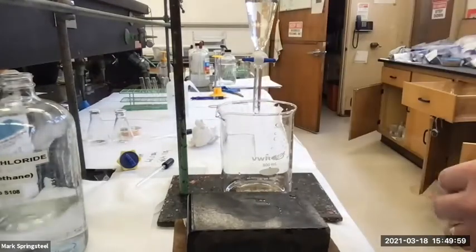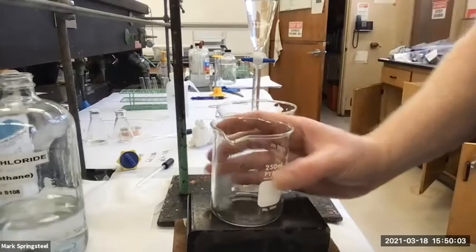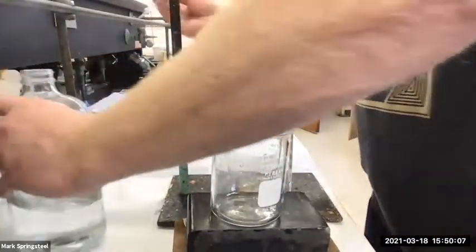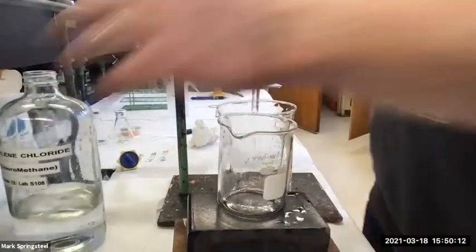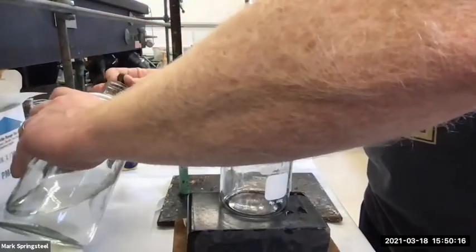Swirl it around, pour it in as well. I'll do another one, try to get the side walls washed down good. Whoa, did you see that? How the methylene chloride was shooting out? That's what I warned you about before. I should have drawn some out, spit it, drawn some out, spit it out.